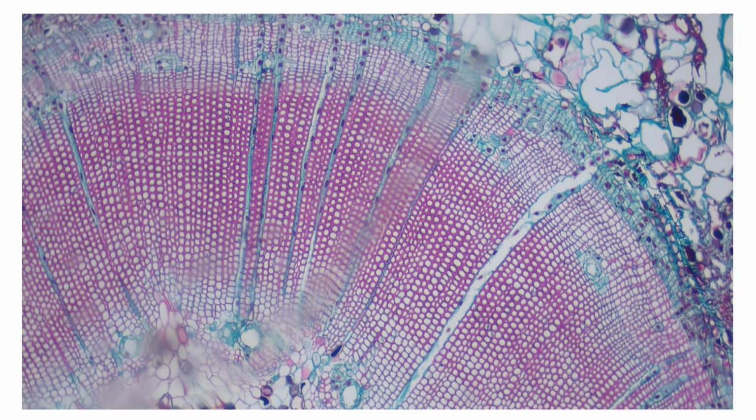And then from the phylum, you could have other questions that would infer knowledge from that phylum. So something maybe like, could this produce seeds? Does this have vascular tissue? Which obviously it does, but that'd be kind of a fun one to throw out there. But things like that. Does it produce fruits, produce flowers, things of that nature? So just keep all that stuff in mind. It's what you could maybe see on the practical, so keep your mind open.